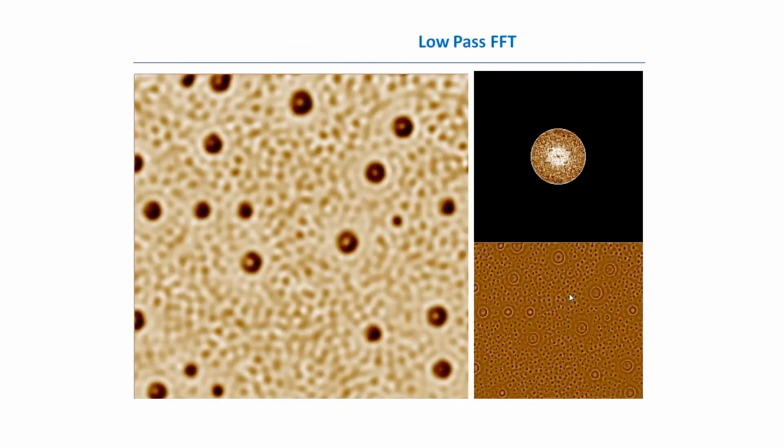But again, if we use this filter too much, meaning that we decrease the band of the filter too much, we'll start to see that the image has lost plenty of details, and in the difference between the result and the original image, we see that the objects really start to appear. And this is a good indicator that we have used our filter too much. If you see your objects clearly in the difference image, that means that you over-filtered your image. So just try to avoid this.